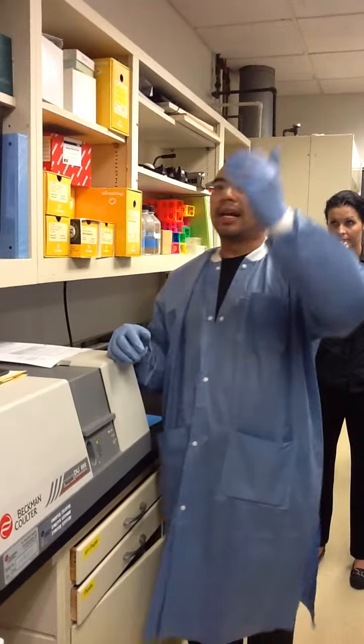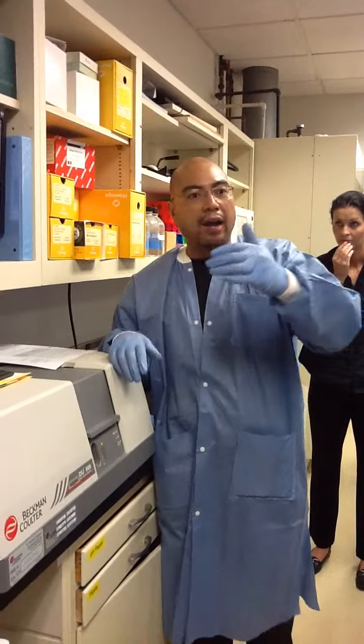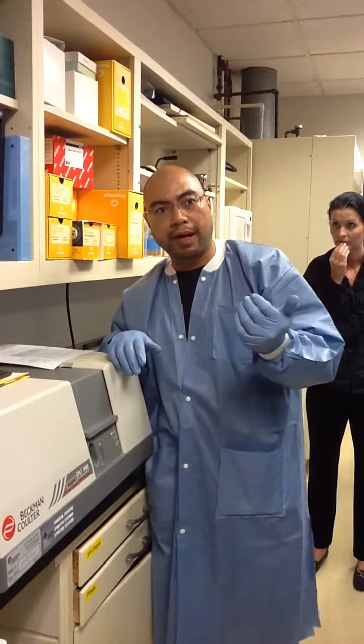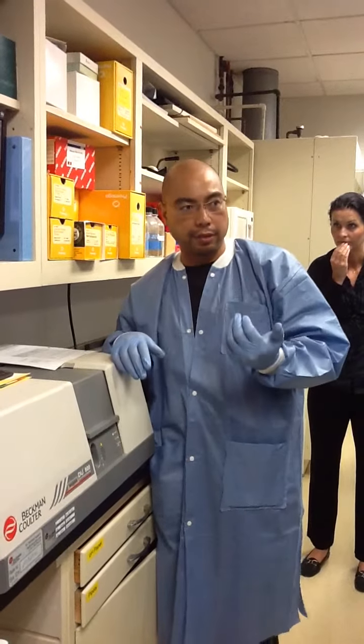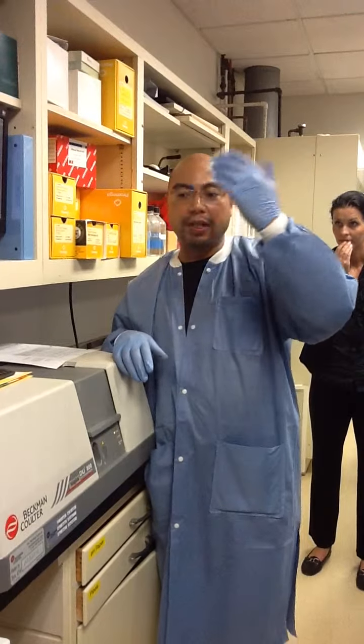The idea is that after it hits 90, 94 degrees, everything is denatured. During the denaturation process, we're losing the overall relative fluorescence units. Say, for example, you have a lot of product with a melting temperature of 82 degrees.